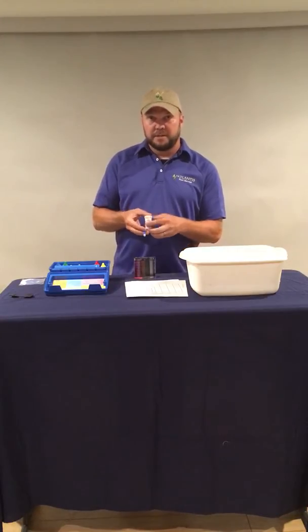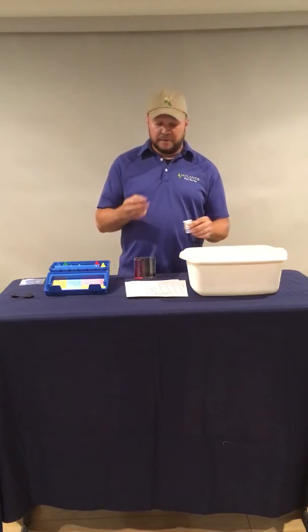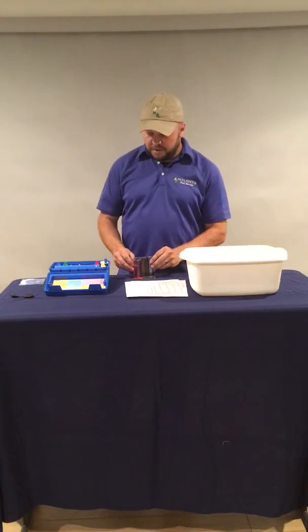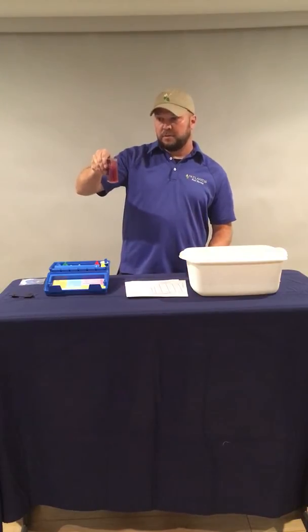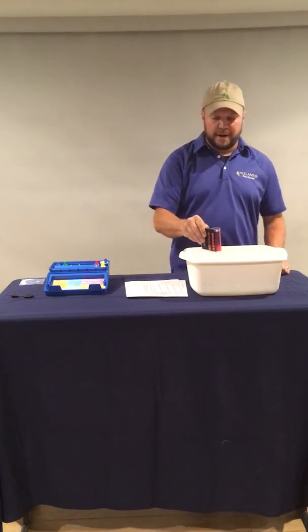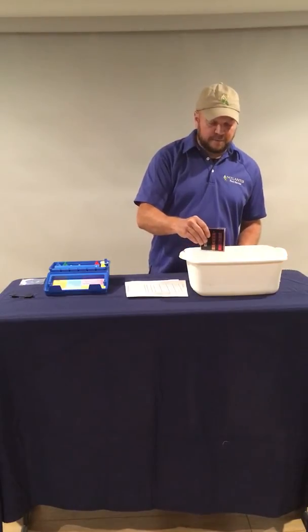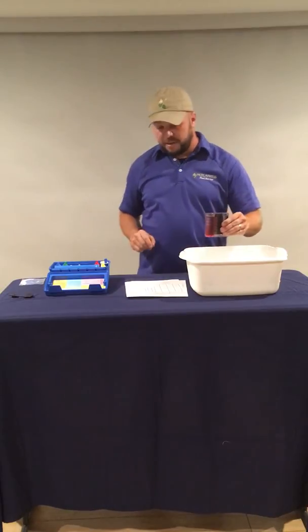Whenever you're done with the reagent, you always close the lid. If you leave that over to the side, it spills. If you get water in there, it's not going to be good anymore, so you always close it up right afterwards. So, if there's chlorine present in the water, it'll turn pink. And sometimes you have to do a little swirl to make sure that everything dissolves properly. Now, I put a little bit of bleach in this tub here to make sure that we had a sample that we could read. So we have a nice bright pink color with that after putting the powder in.